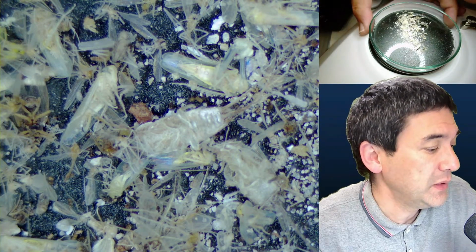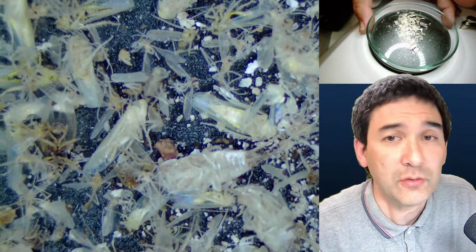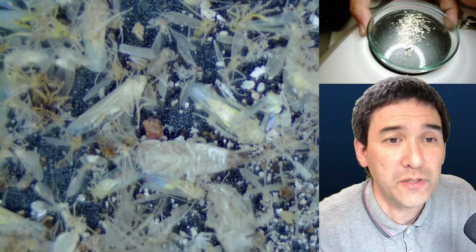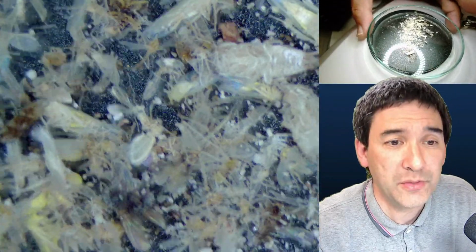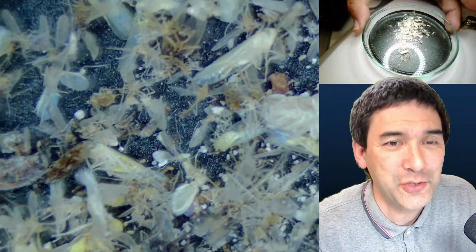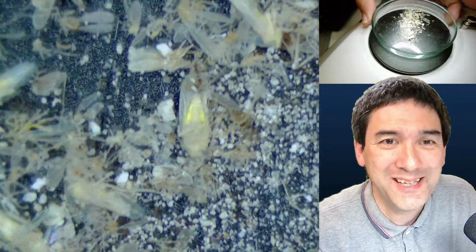What I will be doing as well is fine-tuning my setup here with my stereo microscope. And maybe we can do a little bit of stereo microscopy as well, possibly also with some better specimens. I just collected these 5 minutes before the start of the live stream from my lamp. And it looks pretty messy.